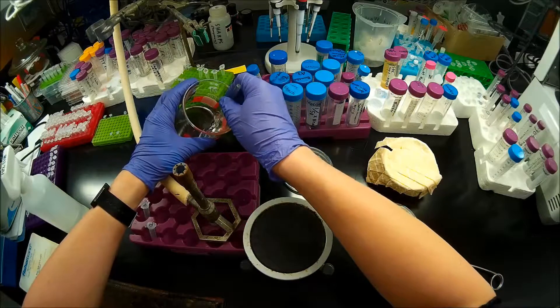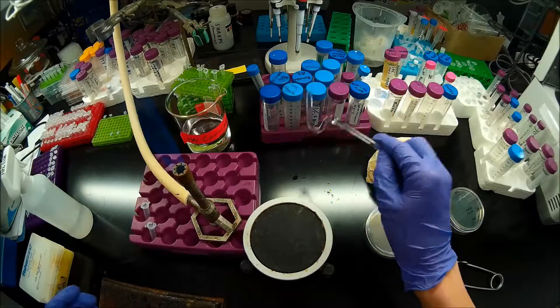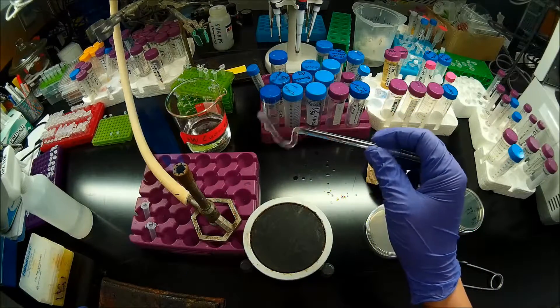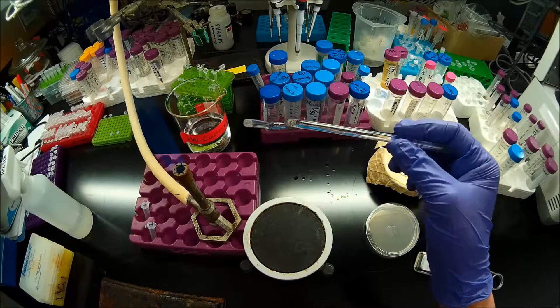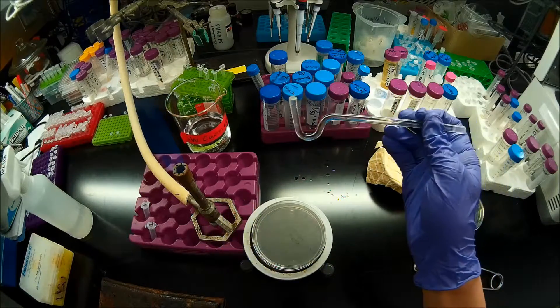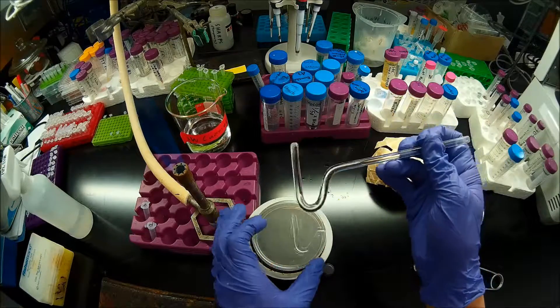So the same thing for the next one. I'll actually put that over there. Same thing for the next one. Dip that in ethanol. Flick it off. You want to be sure that you're not flicking flaming ethanol onto paper or plastic. I almost got that thing.